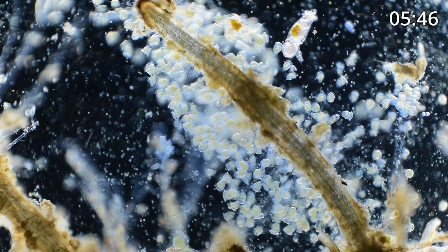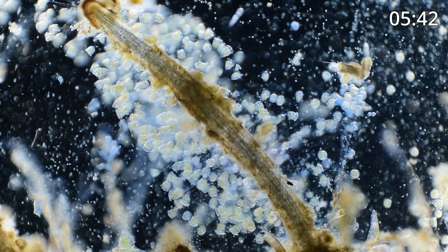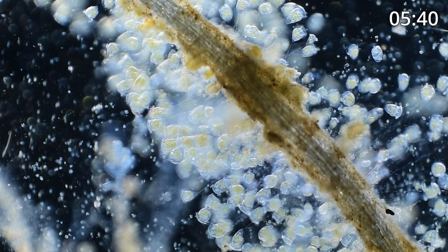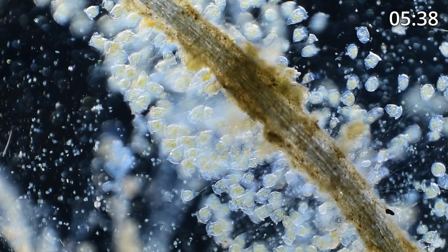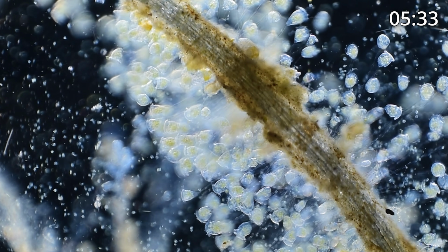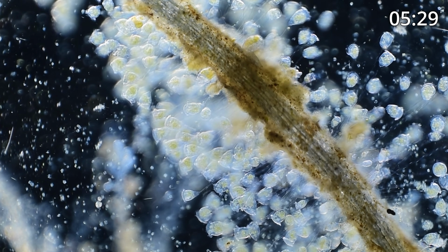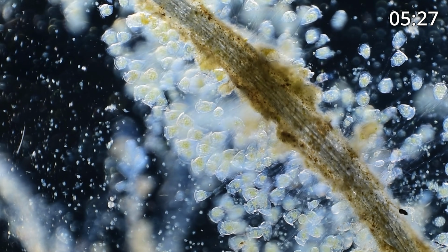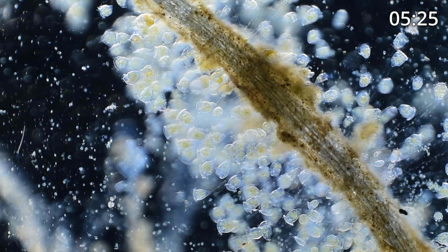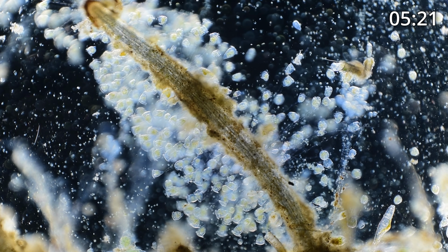These peritrichs, like this cluster of what I'm assuming is vorticella that you see here, are single-cell ciliate organisms. They have rows of cilia that you can see beating and twisting and causing a current inside the water column, which, because of all these little white particles that you see, you can actually see them attracting food into their open ends, which allows them to feed.